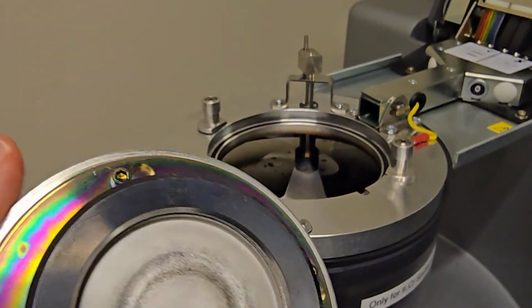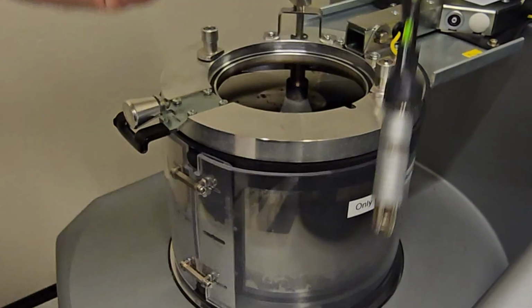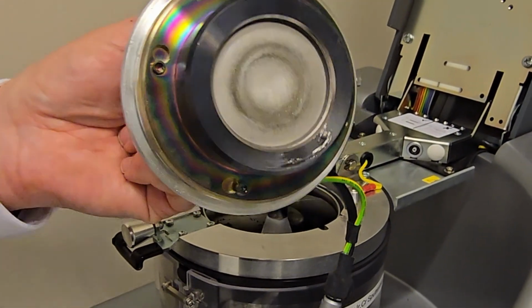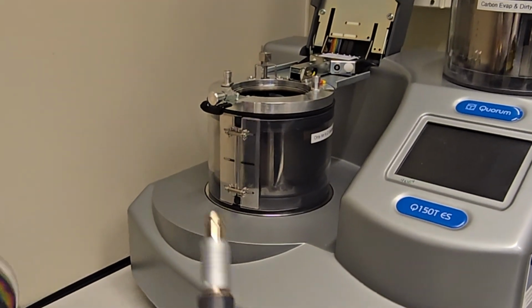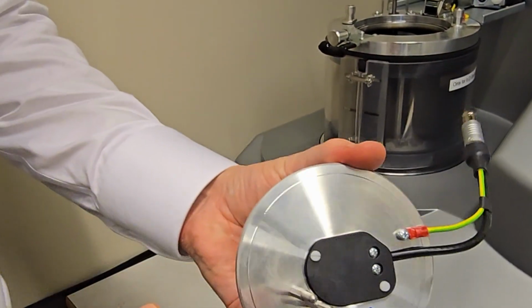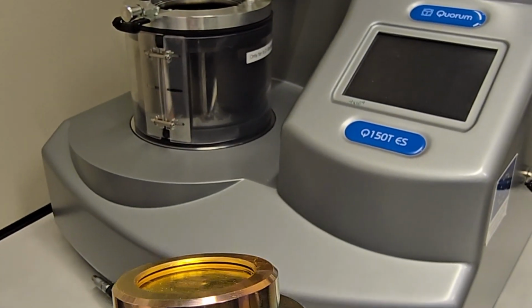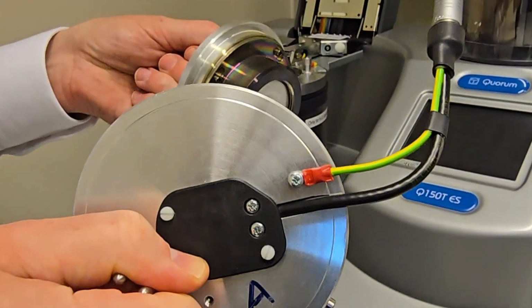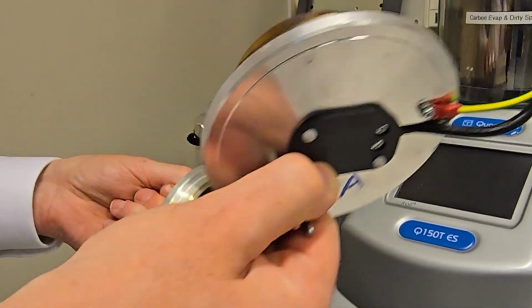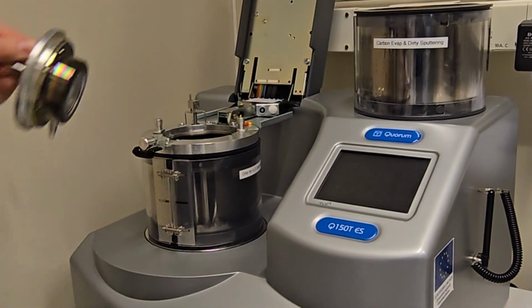The machine knows what target is mounted from this pin combination. Here we have mounted iridium. If you want to, for example, coat gold, I have one with 2 pins here, and the machine is programmed because we have mounted gold here. So you can buy all kinds of targets. Why should I use gold, and why iridium and so on? I will talk a little bit about that now.